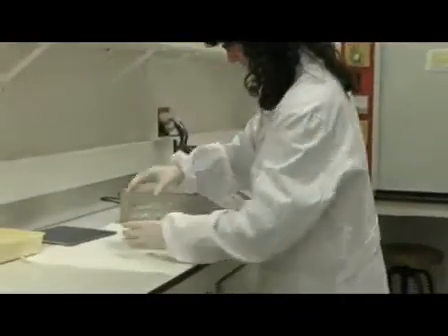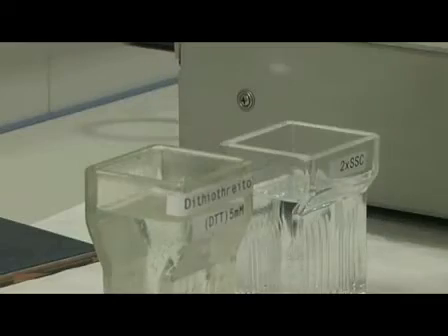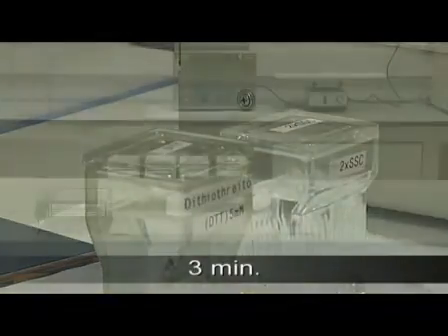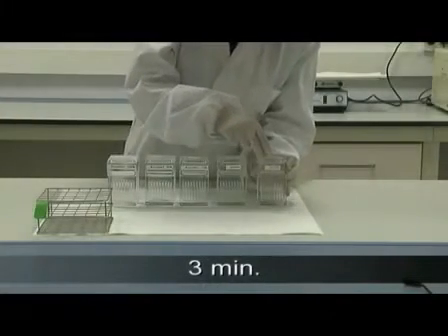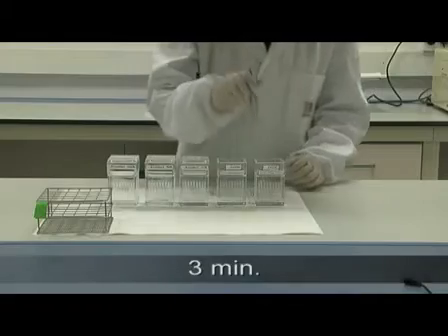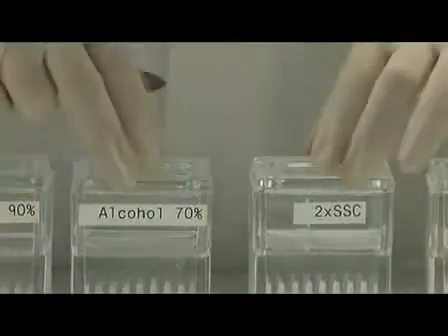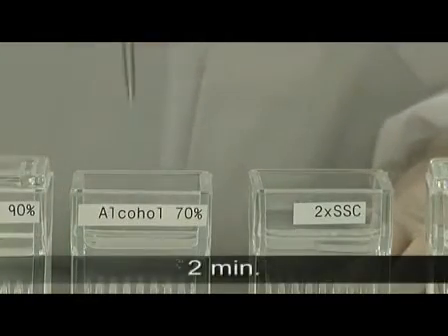After this time, the slides must be transferred immediately to two times SSC for three minutes. And again for a further three minutes, followed by two minutes in each of the ethanol Coplin jars.